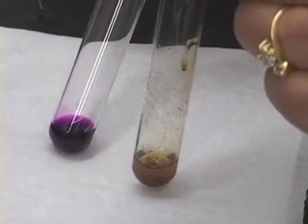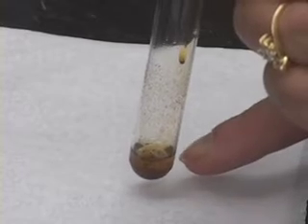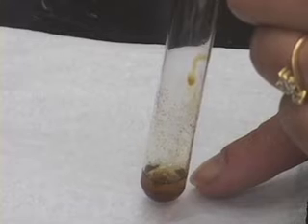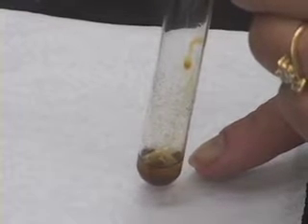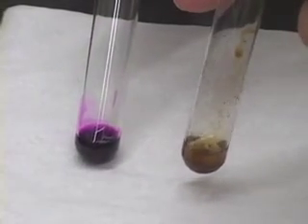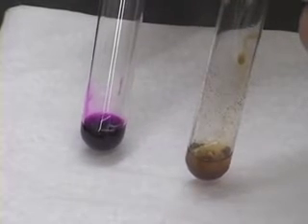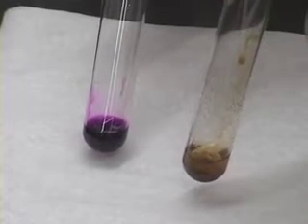Let us compare the two — the potassium permanganate reagent here, and this is the test tube in which I had the unsaturated compound. We can clearly see that the purple color disappeared, which indicates that the test compound in this test tube was indeed unsaturated.